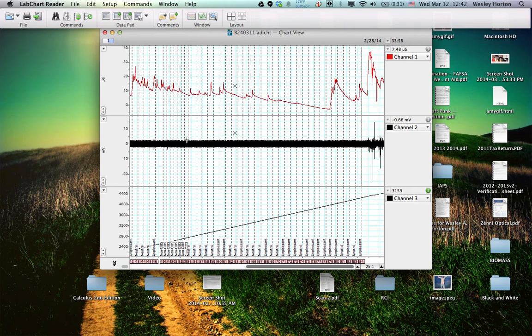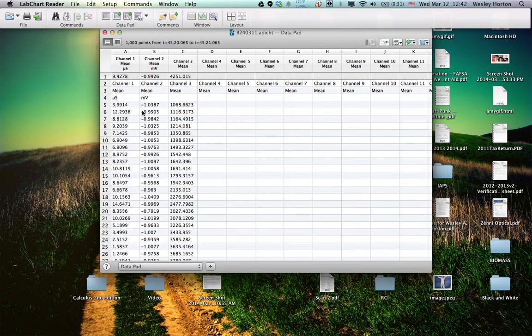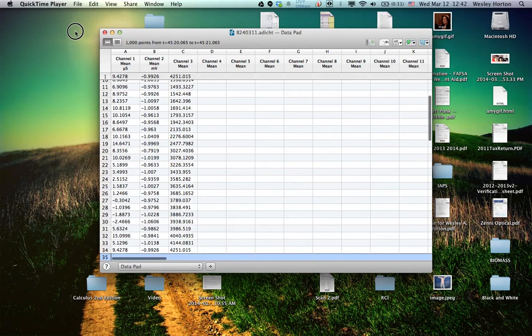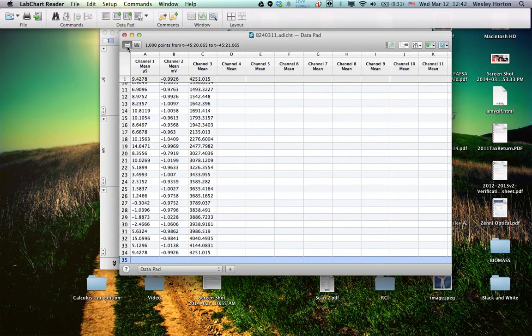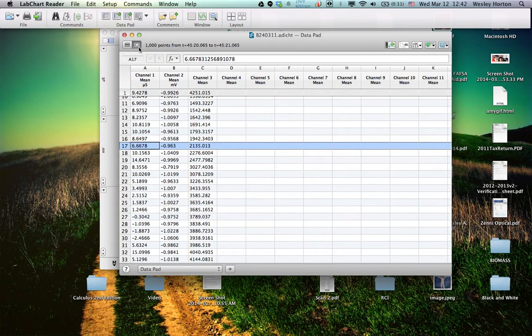Alright. So it pulled that data for us. So we're going to open our data pad, it's right here, this button. And so the first thing we need to do whenever we're in the data pad is to get off of this block thing. So this right here, this button with the block across is row mode, and so it only selects certain rows. We want specifically cells. So we'll click that.